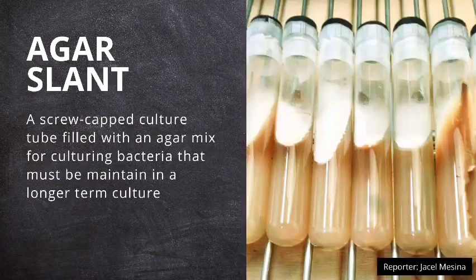On the other hand, an agar slant, also known as an agar slant tube, is a screw cap culture tube partly filled with an agar mix such as nutrient agar. Bacteria may be grown in this second type of medium if the purpose is to maintain them in a longer-term culture. Generally, bacteria grown on slants will remain viable for a few weeks to a few months and sometimes longer if stored in a refrigerator.